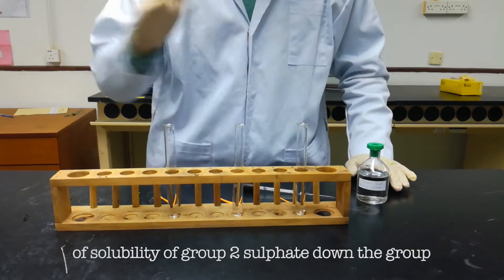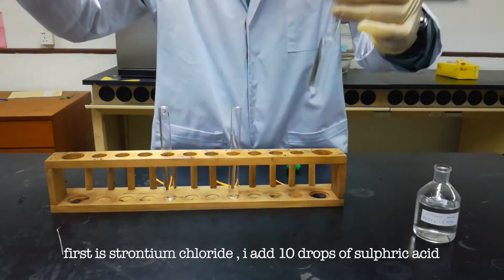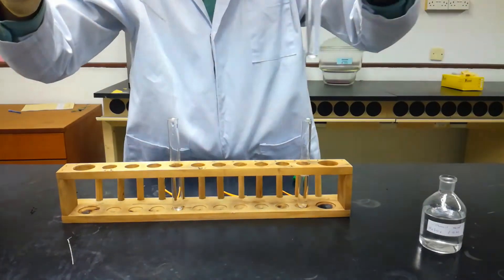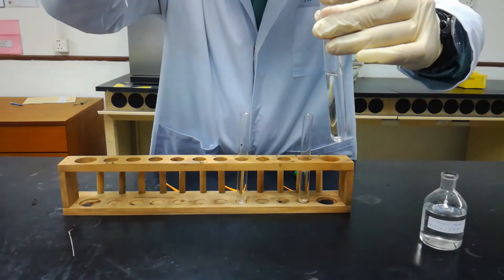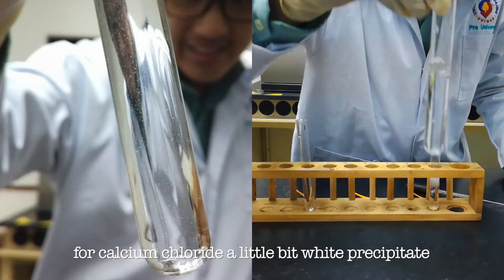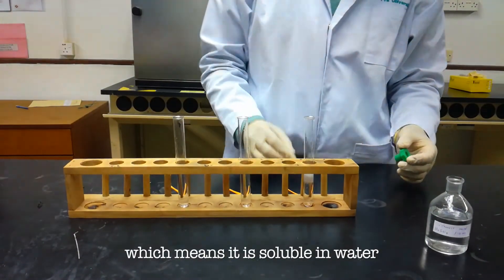For the next experiment, we will study the solubility pattern of group 2 sulfates down the group. Here I have strontium chloride, calcium chloride, and magnesium chloride, and I will add them with sulfuric acid. First, strontium chloride — I add 10 drops of sulfuric acid. Next, calcium chloride — I add 10 drops of sulfuric acid. And lastly, magnesium chloride — I add 10 drops of sulfuric acid. For strontium chloride, it forms a white precipitate, which means it is insoluble in water. For calcium chloride, a little bit of white precipitate forms, which means it is partially soluble in water. For magnesium chloride, we see no reaction at all, which means it is soluble in water.